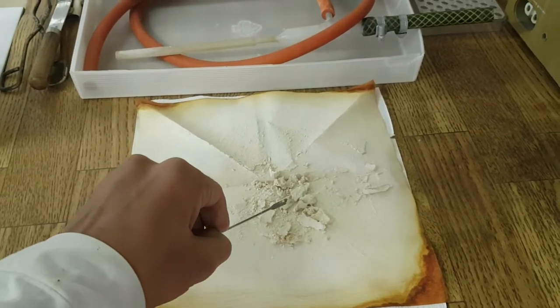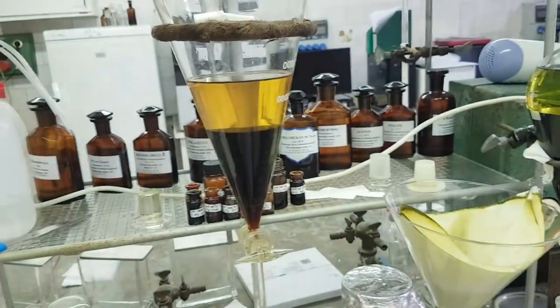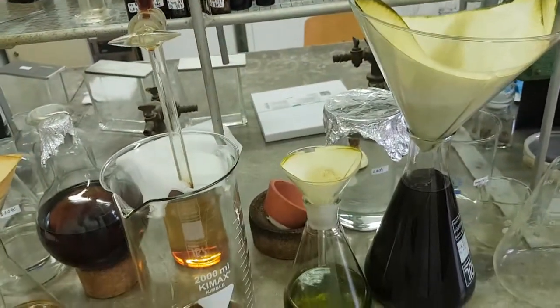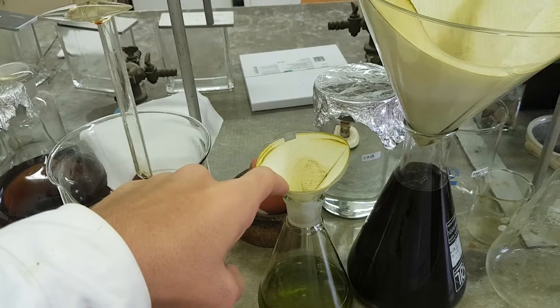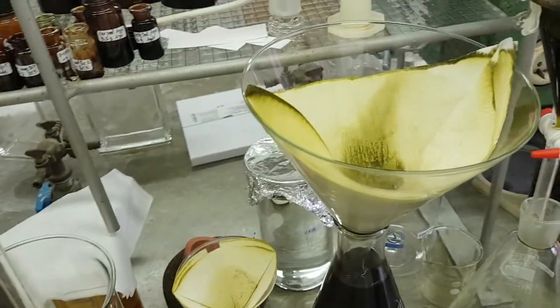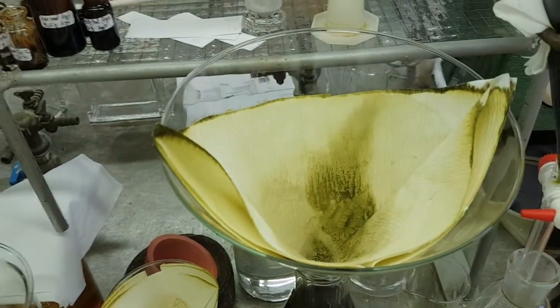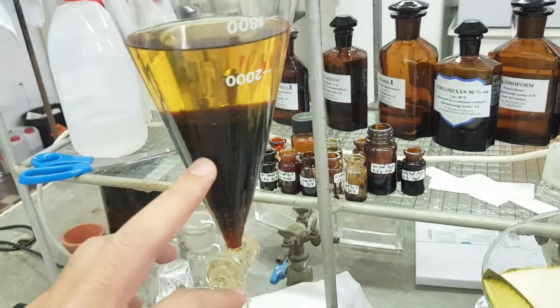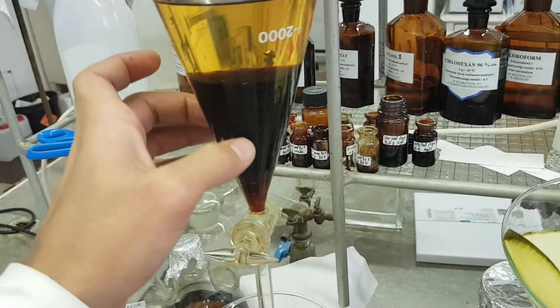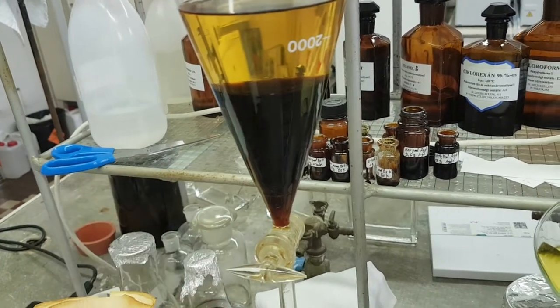This powder was prepared by liquid-liquid extraction. You will need a separatory funnel, and sometimes also a funnel and paper filter. In my case, I didn't find high solubility of my mixture — I prepared this extract in methanol, but while dissolving my extract in methanol, I could not dissolve it totally.